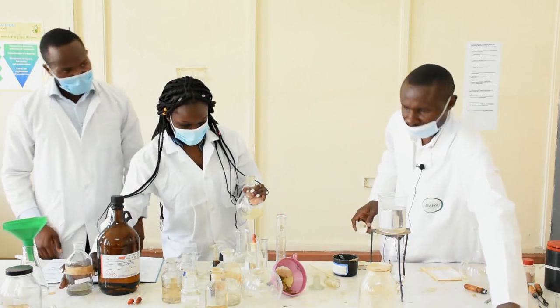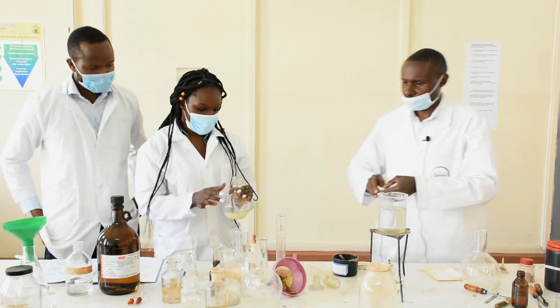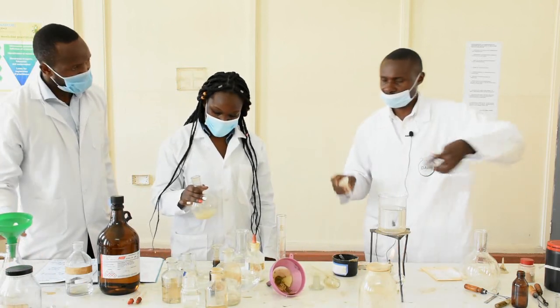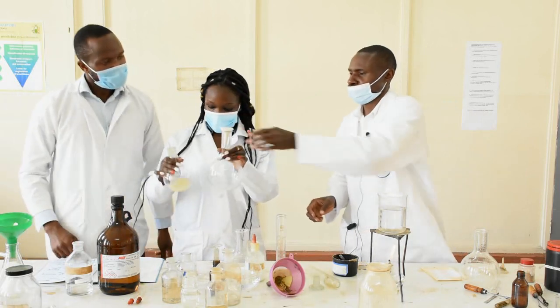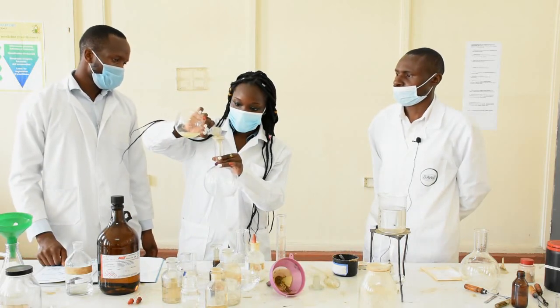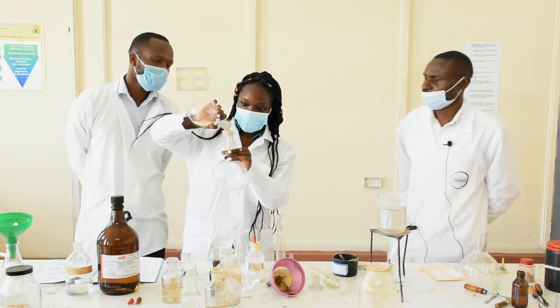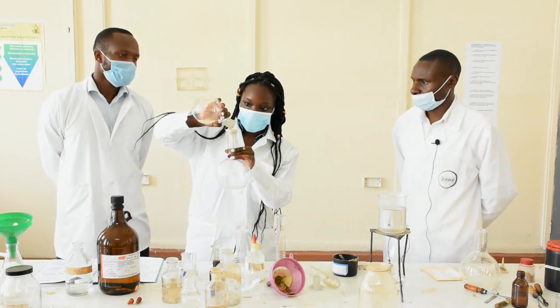After this second filtration, you now extract successively using chloroform. Measure 2 ml of chloroform, add it to the separating funnel containing the filtrate, and shake. You hold the separating funnel and extract. The process is repeated twice for successful extraction.